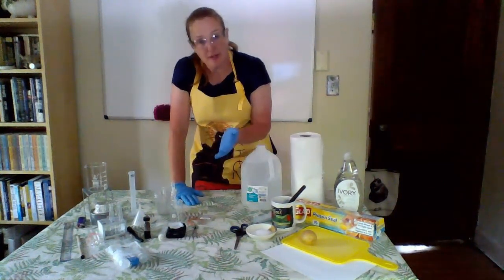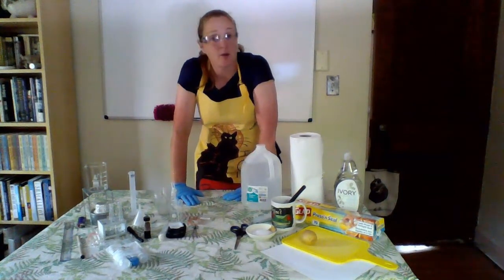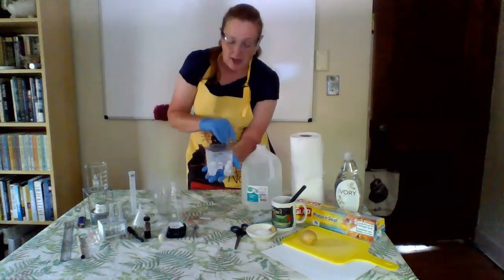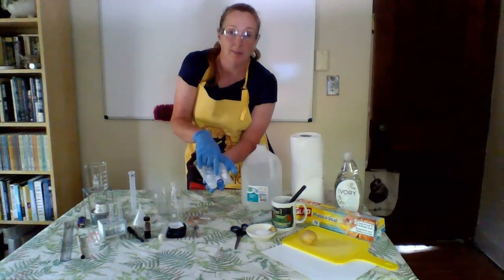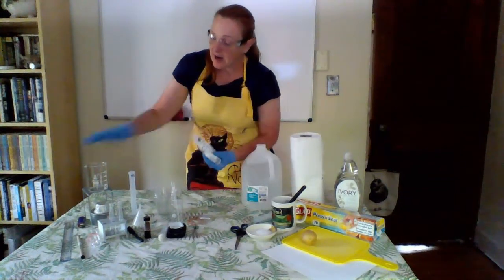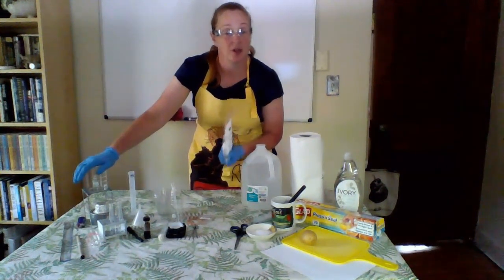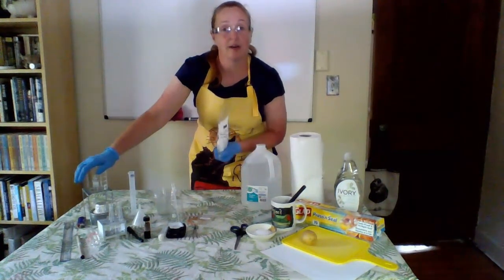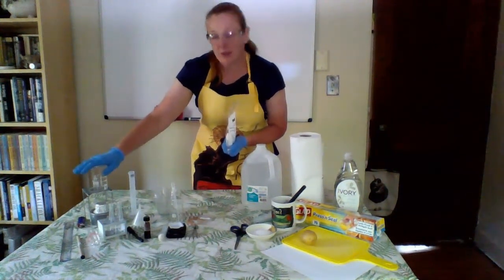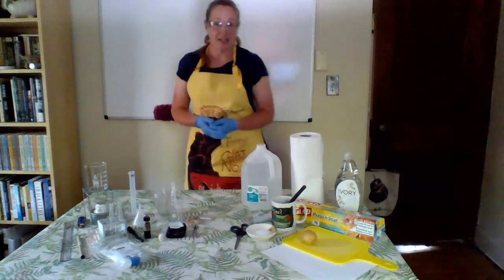So I have the setup of supplies, and one of the things that I wanted to point out is that in this week's lab, we are going to be testing for sugars again. In your comparative cell transport packet, you'll notice that here we have our Benedict's reagent again, that blue reagent testing for monosaccharides, simple sugars. And I decided to go ahead and pull out my fuel and beaker again. I'm going to use the same method that I used with the biological molecules lab in order to heat up my Benedict's reagent and get that reaction to occur. So what you see here is a little bit different than what is being asked for in the hands-on lab material list, and that is intentional.